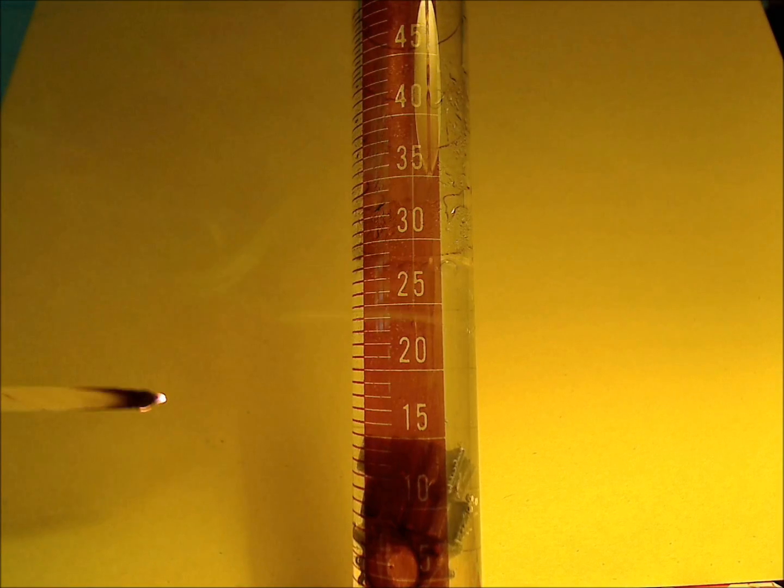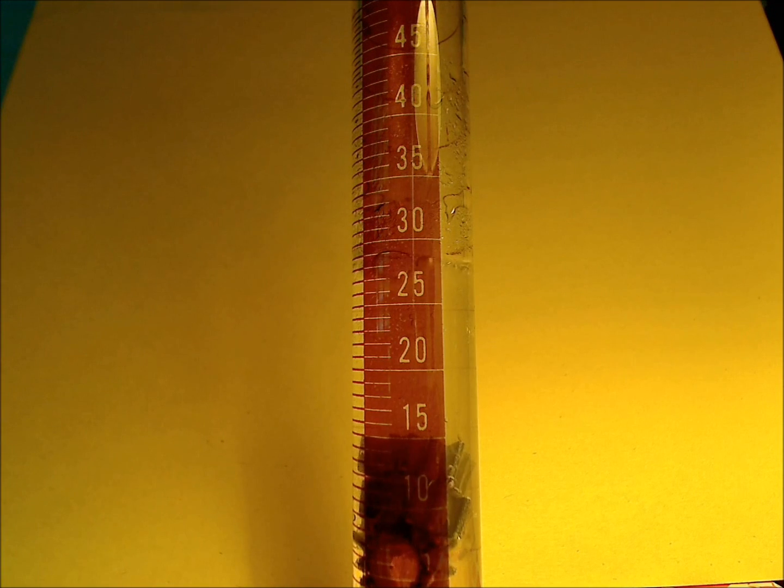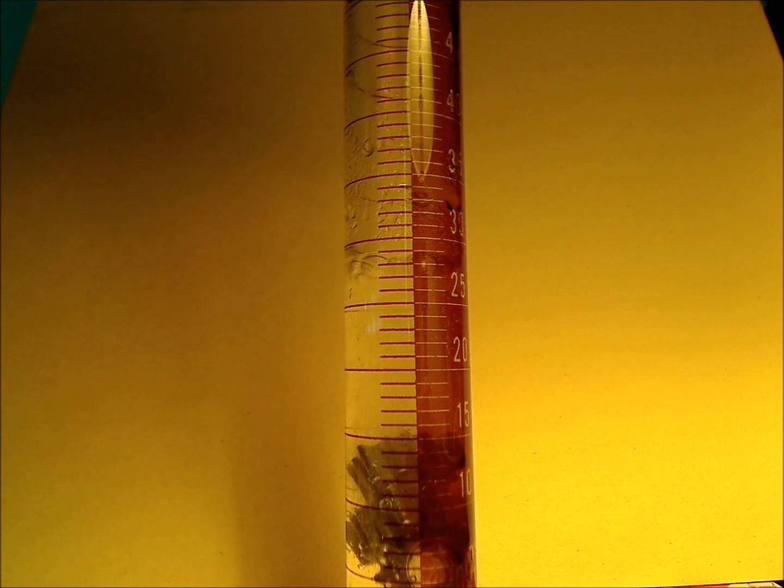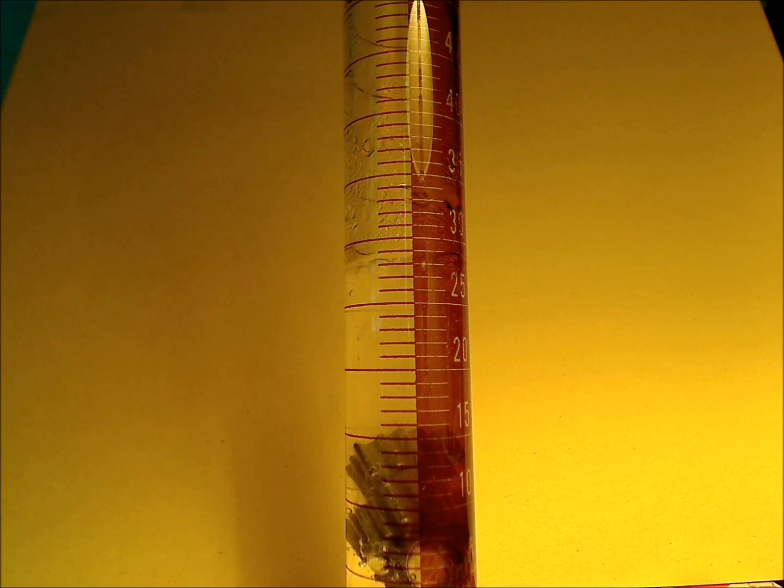You can do this over and over again. It just smells up the room a bit. But it's a nice reaction and it really builds up. It takes a while, but it really builds up. You can see it's going pretty fast now. Let me turn this so you can see the bubbles a little better. I hope they're visible.